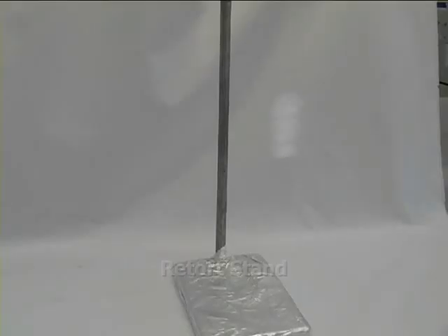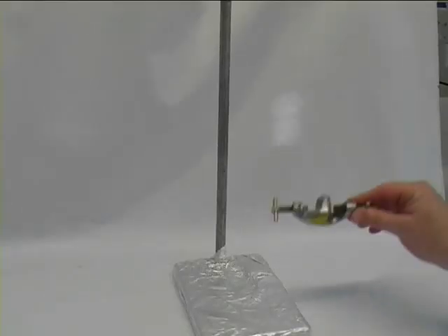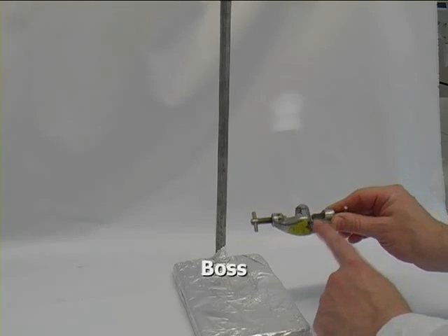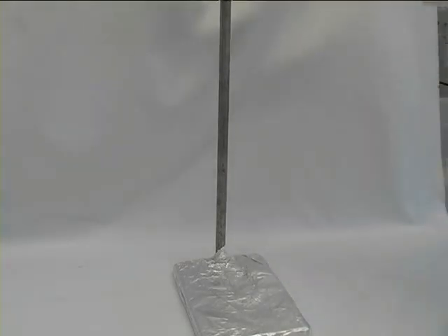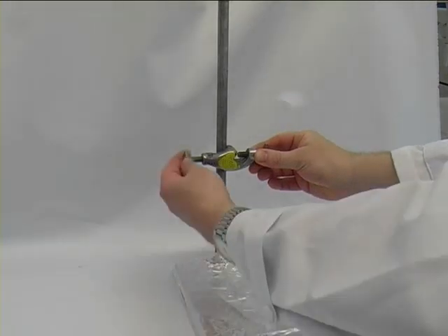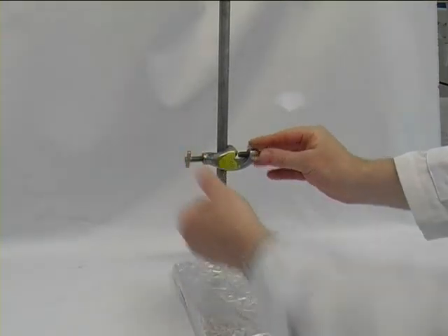The next step is to filter off your solid using vacuum filtration technique. We will start off with a retort stand and then we add this boss. Please make sure that the opening points upwards.